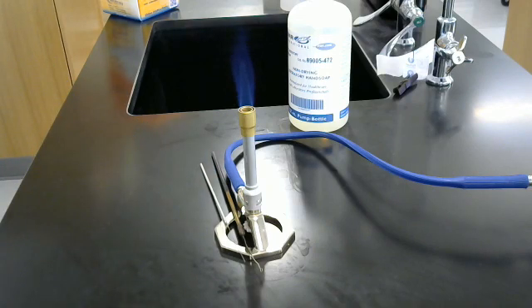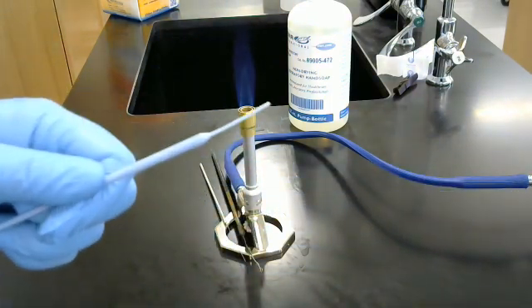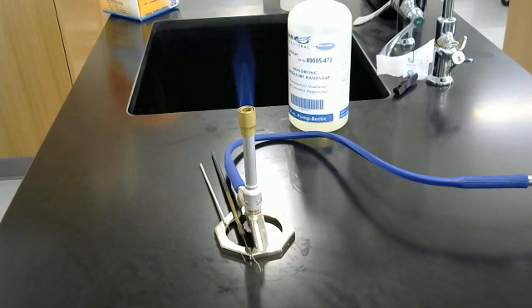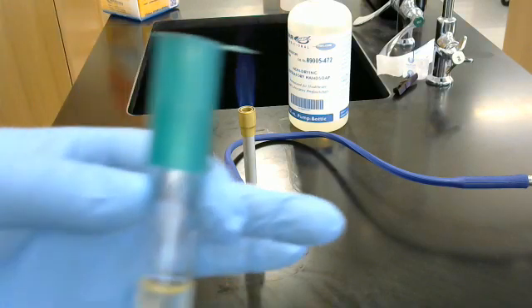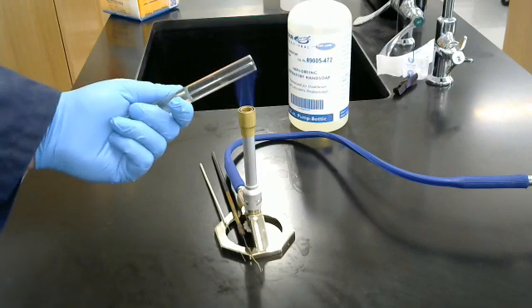Last one, we're going to take a look at our tool again, our disposable tools. This is what a disposable tool looks like. We've been working with that end, which is the loop, the other end is actually a needle. Same as before, take our gel, one, two, three.